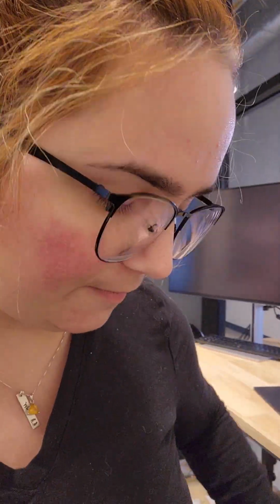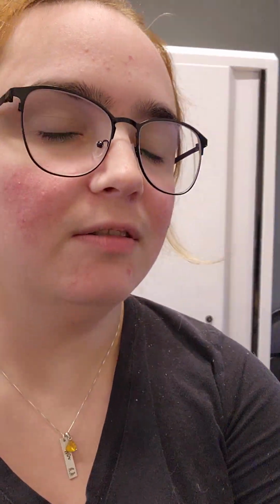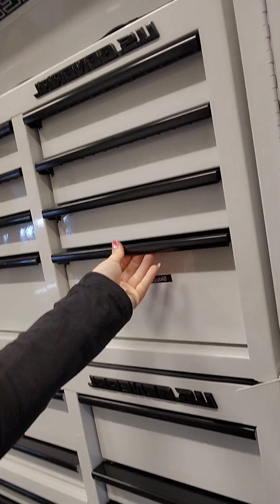I already have this in focus because I've been doing some imaging already, but if you don't have it in focus yet, I recommend doing a known slide from in here, one of these things, so that you can get it in the right plane, because C. elegans, as you know, is see-through, and it's going to be really hard to focus something see-through when you don't know exactly where it is.